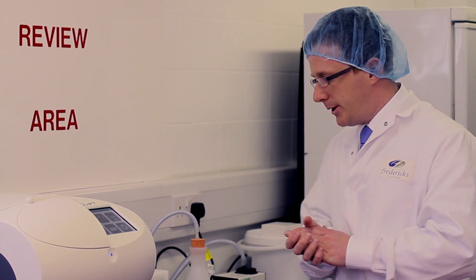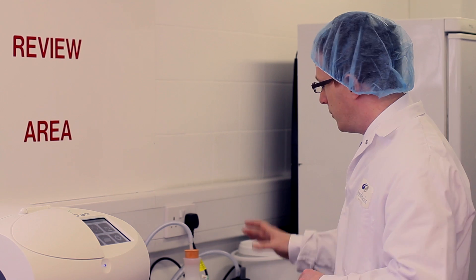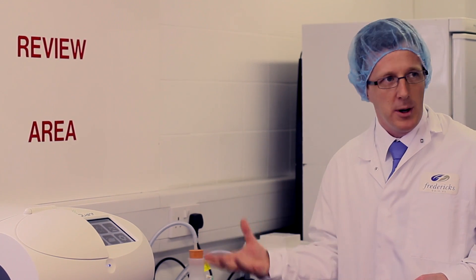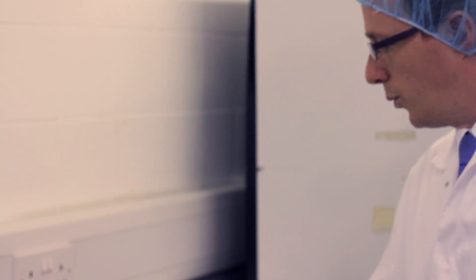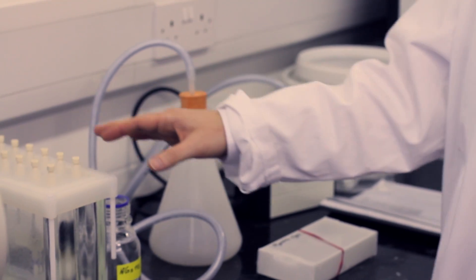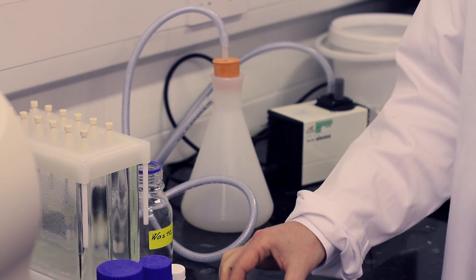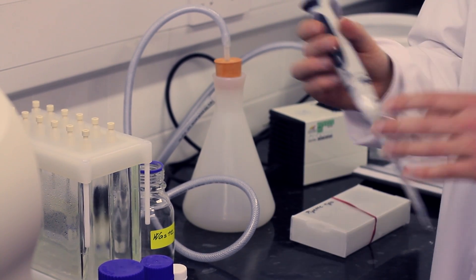You've got conditioning, loading, and then washing. The conditioning will just use two different solvents — we'll label those solvent A and B. This is all very affordable kit that can be supplied by our company: a simple vacuum pump, a liquid trap, and a vacuum manifold. We then apply the solutions with two different liquid handling pipettes.